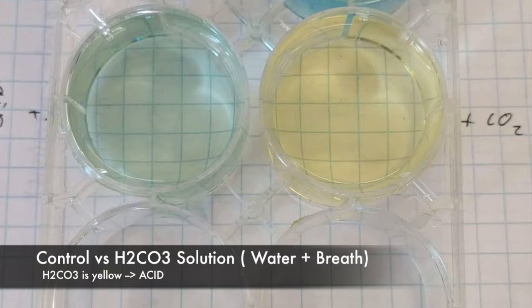Only adding air from the atmosphere will not achieve the same result, as the air in our atmosphere is composed mostly of nitrogen, which is an inert gas and does not react with the solution. Thus, it does not affect the pH or change the color.